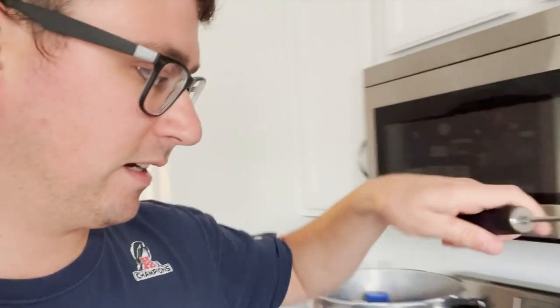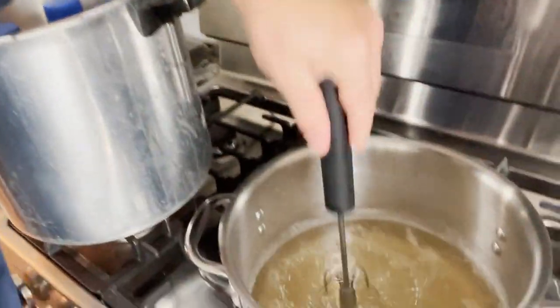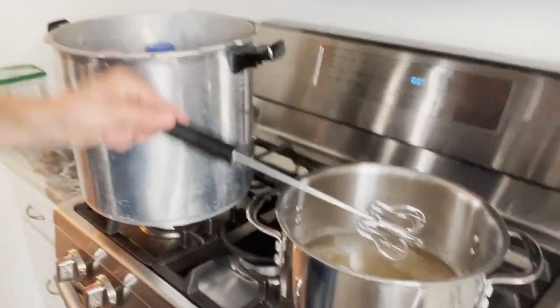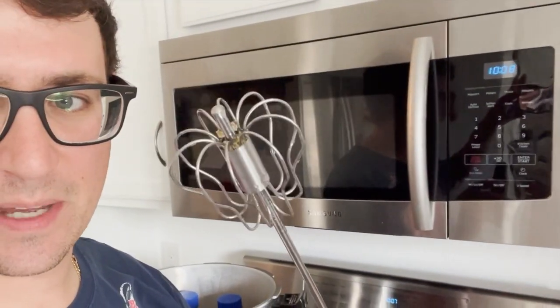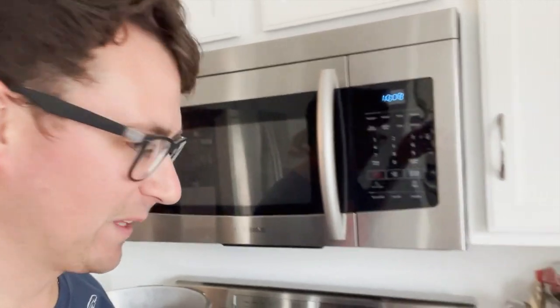I really like using this tool here, it kind of mixes it up really nice. I got it as a gift from my mother-in-law and it's probably the best agar mixer ever.